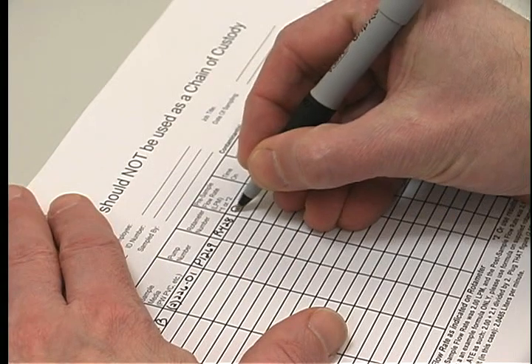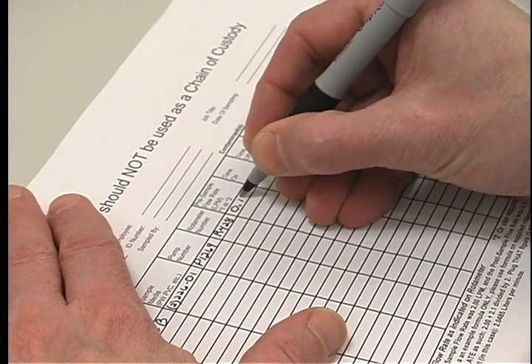After you are satisfied with the flow rate, record the value on the field pump data sheet.